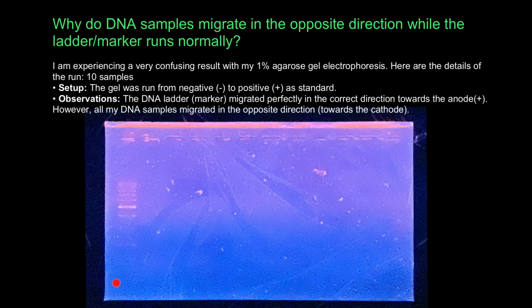So take a look. Here's the gel, here are the wells on this side, and the ladder moves in this direction, but you do not see any bands here. You see them all here moving in the opposite direction. And here is a description of the situation.